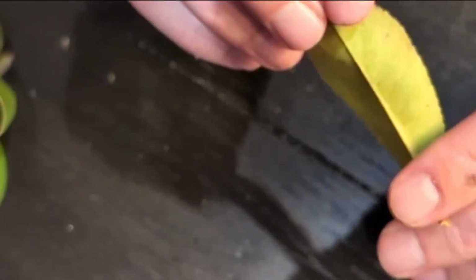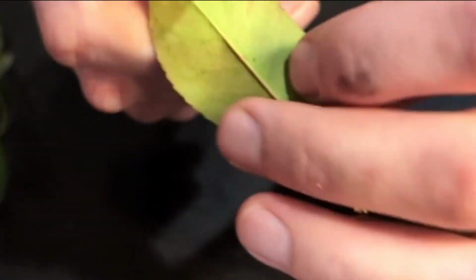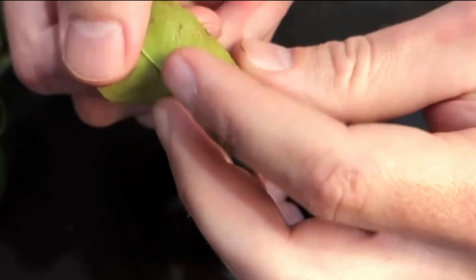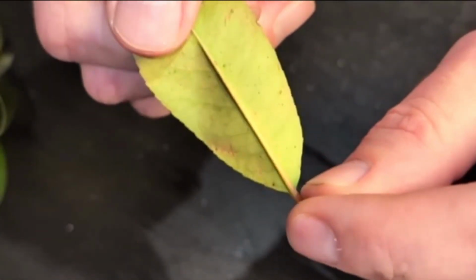Now, here we have a dicot leaf. We know that because it's not parallel veins. You can see the midrib here. See if I can get that better in focus. And you can see little veins moving out to the side here throughout. I'll flip it over, maybe you can see it better. You can see little veins moving out, particularly like a network of veins. That's a pinnately veined leaf, another dicot style venation.